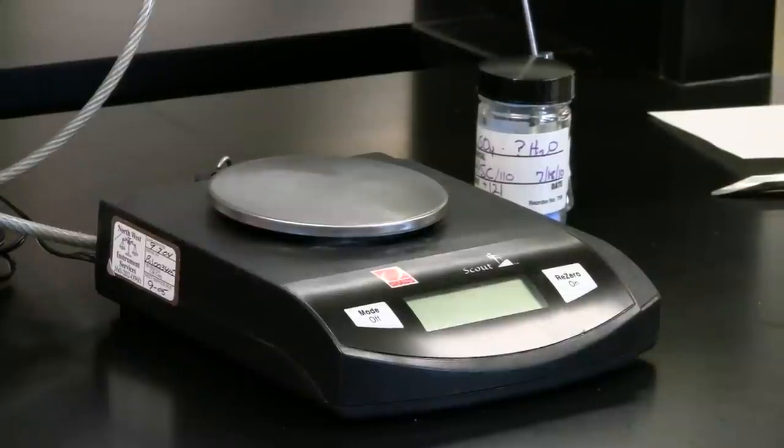In your first two quarters of chemistry, you will only use the top-loading balances, shown here.